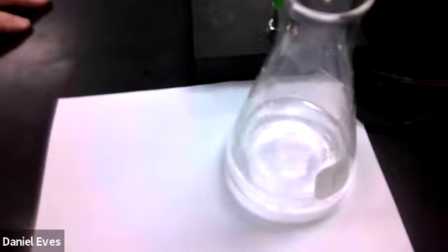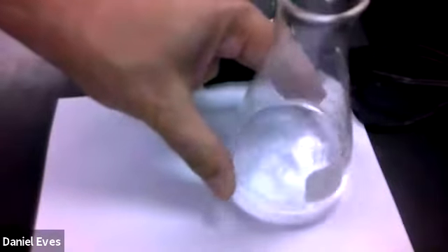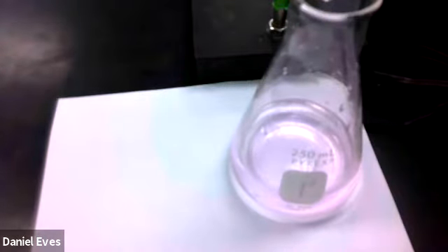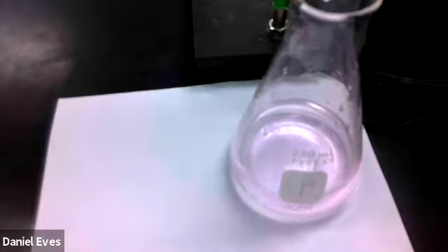Adding. Okay, we're going to slow that down, swirl it a little bit more. It looks like it's persisting. Just the palest of pink, but that's what we're looking for when we do this titration. Now we're going to let this sit for about 30 seconds and see if everything stays there at that very, very pale pink. Move it here so you can have a look at it, how pink that is. It's not very pink at all, but it is just a little bit. Yes, that is the color that we're looking for. It's just the faintest whisper of pink here.